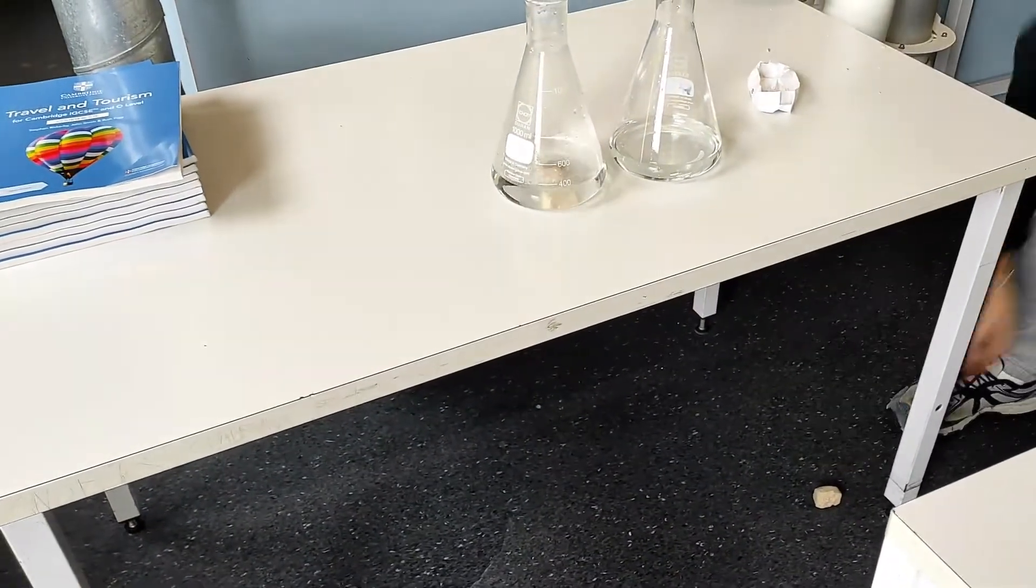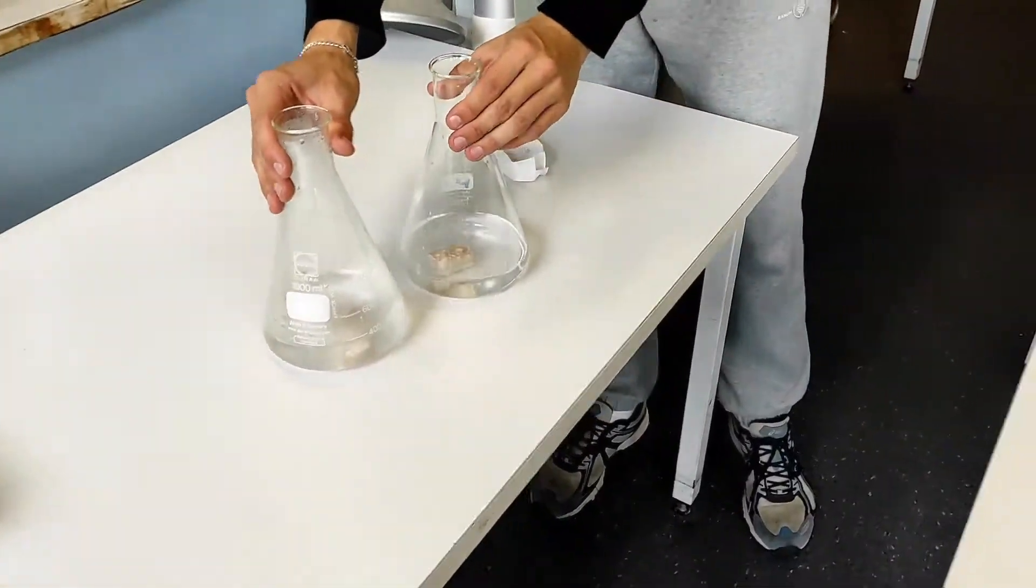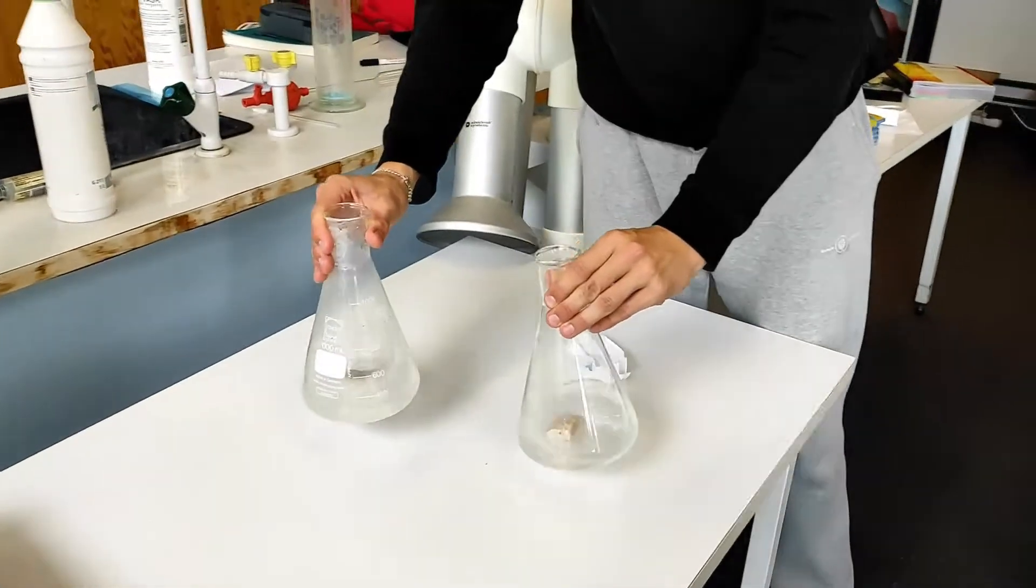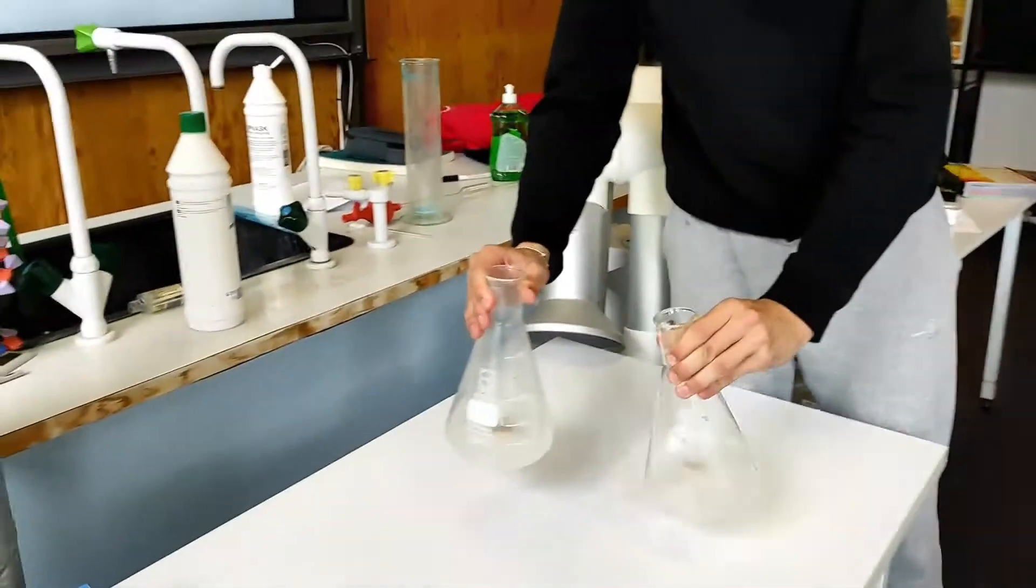It's hot water. Then twirl it around until it gets dissolved. Yeah, he's a very good twirler.